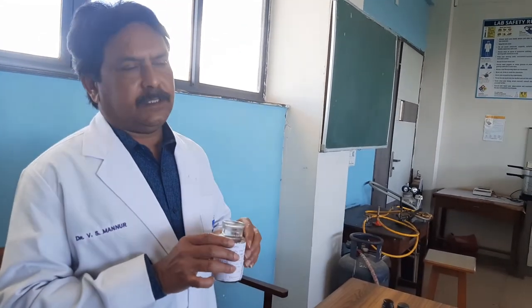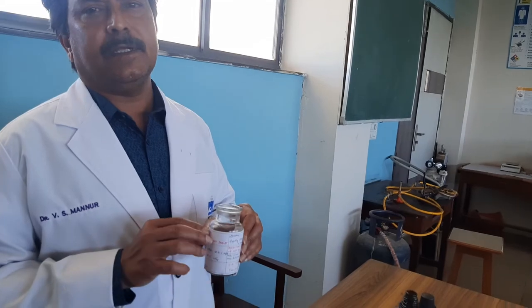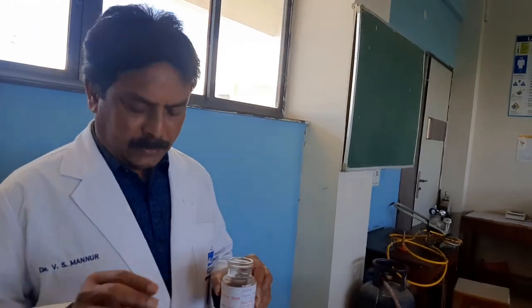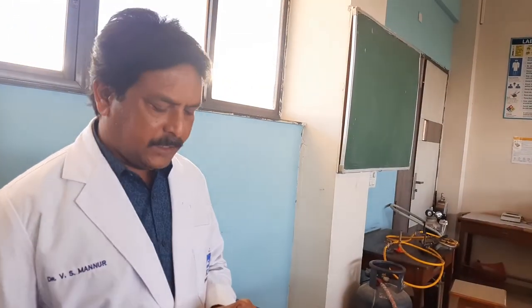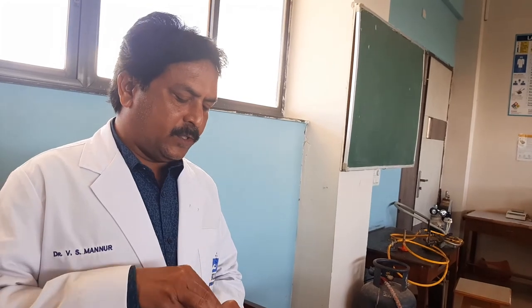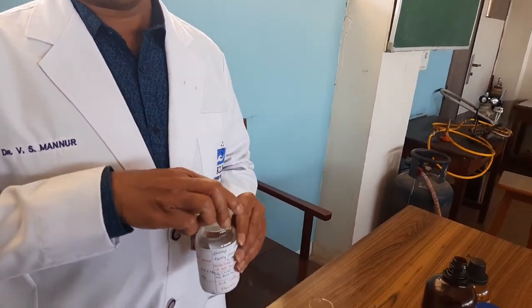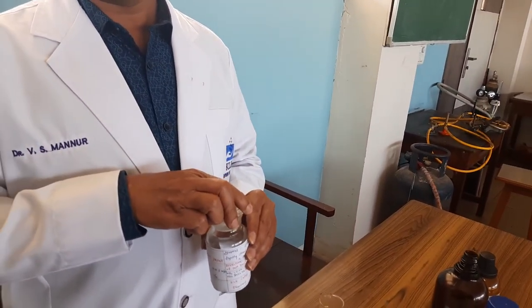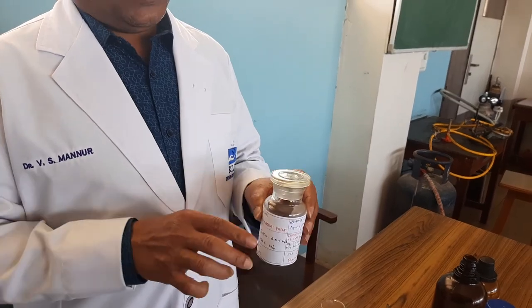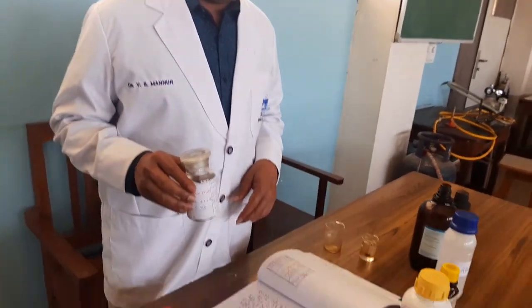This preparation is prepared in KLE College of Pharmacy, Belagavi. Finally, close the container with a tight lid to prevent the evaporation of alcohol and iodine.